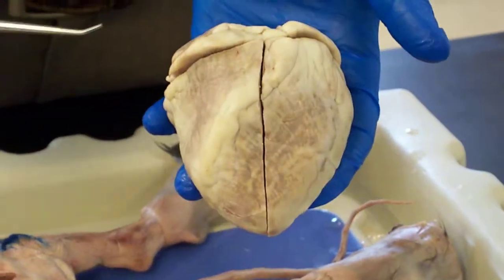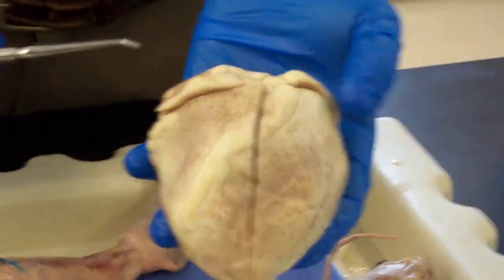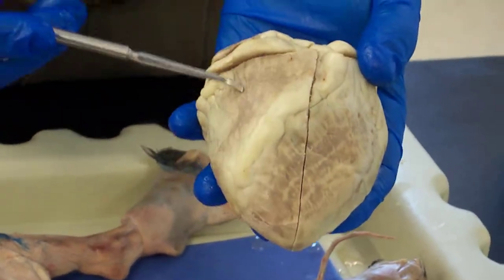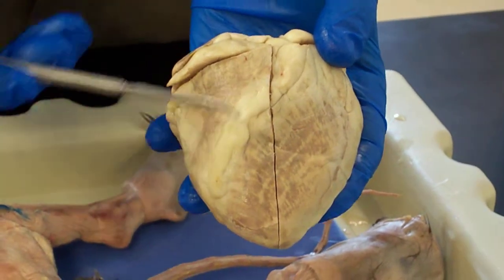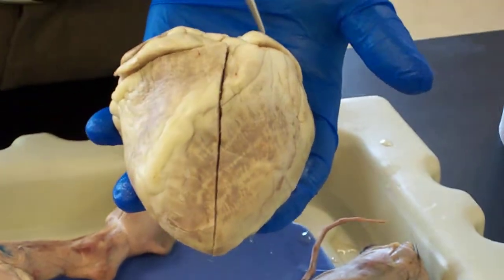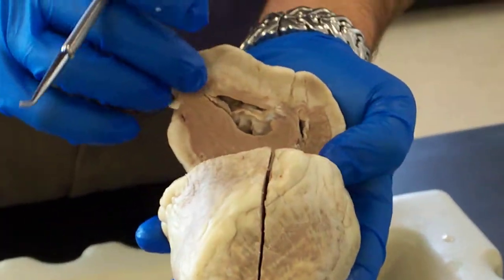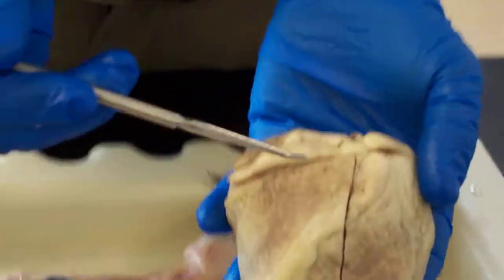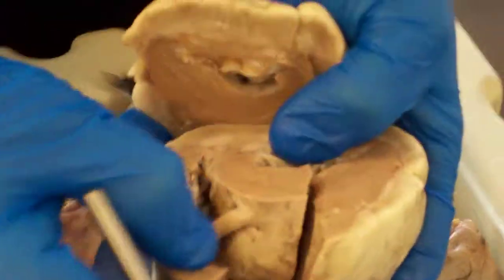First we can see the atria at the top — this is difficult to see because it's all squished down here, but we're seeing the outside of the right atrium and the outside of the right ventricle. This is the interventricular sulcus in between the two ventricles. You can see the large left ventricle here, and above that left ventricle there's a left atrium. This is what leads into the right atrium, and then the right ventricle is just below that.